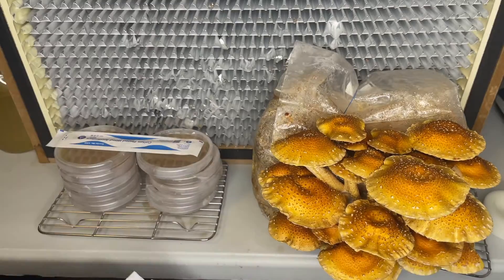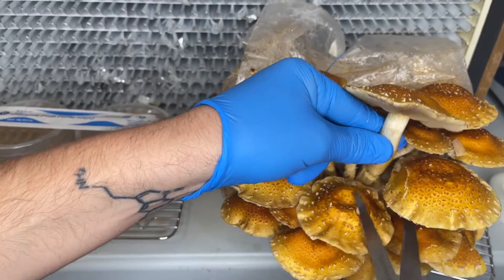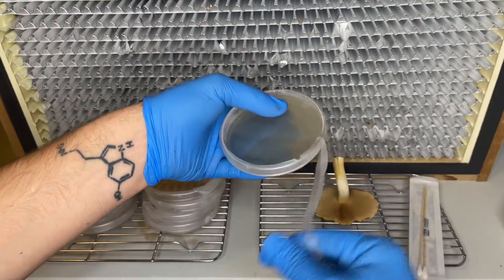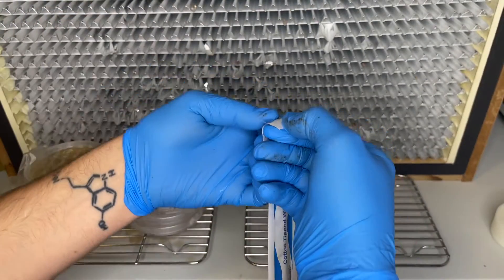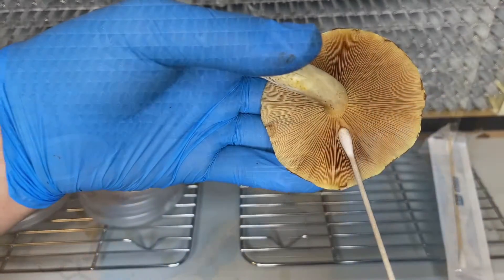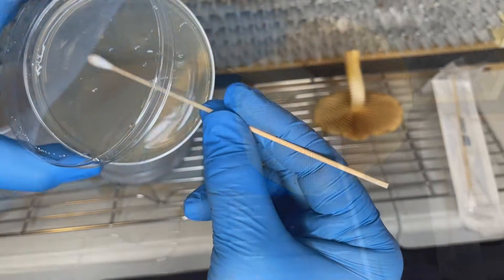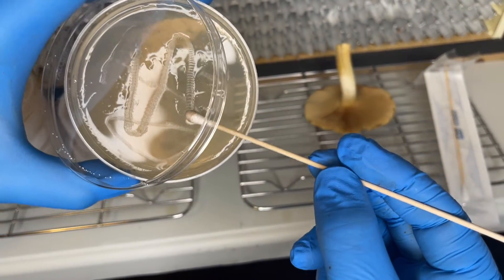Use a pair of clean scissors to select your favorite mushroom cap. The trick is to rotate your cotton swab directly in between two gills. The spores can now be streaked across an agar plate in an S pattern.